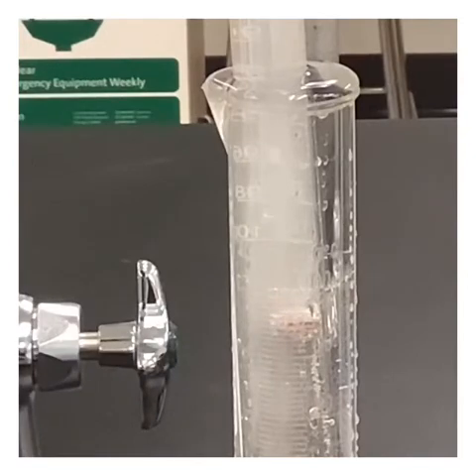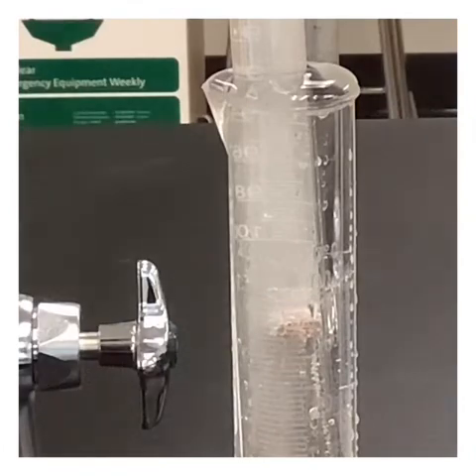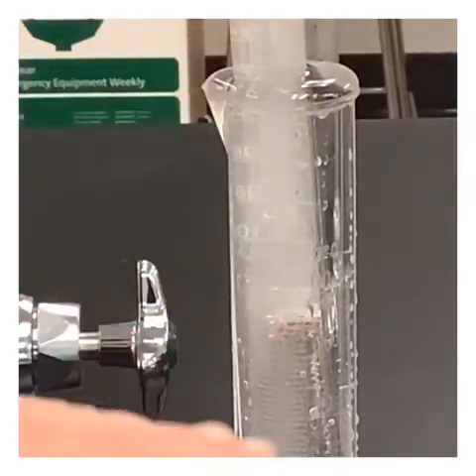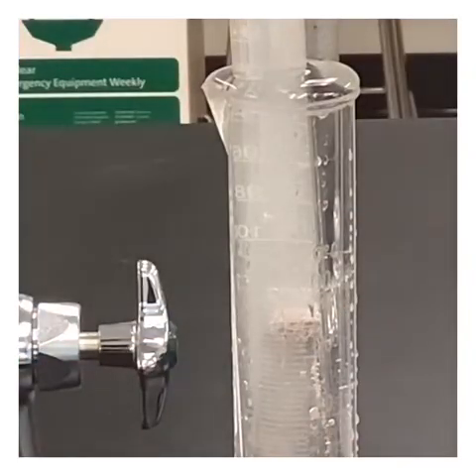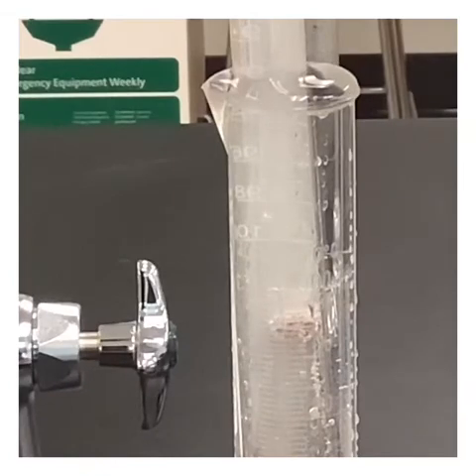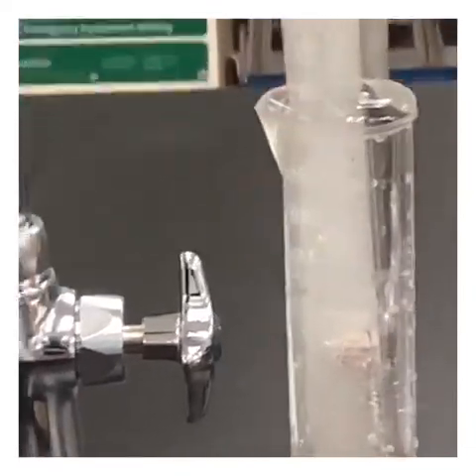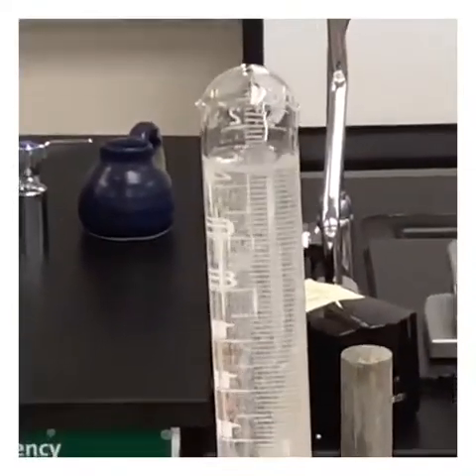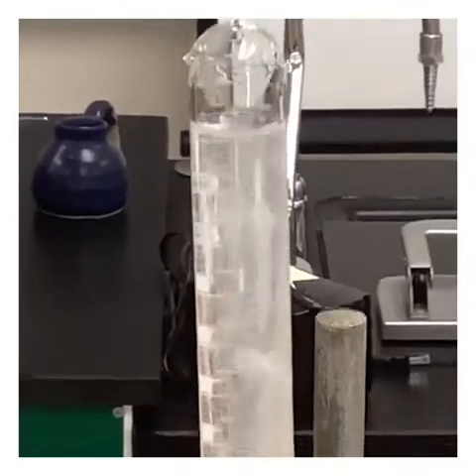All right, so we see that it's actually getting pretty vigorous now because most of the acid is coming down. We can see that as the bubble's filling up, the water is getting pushed down into the cylinder, which is causing it to overflow, and that's why I have it in the tray. You can see up at the top, we're getting a pretty good layer of gas forming now. We're going to let this thing just keep going and going.